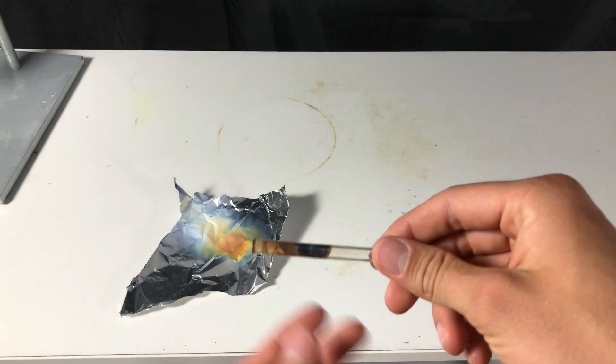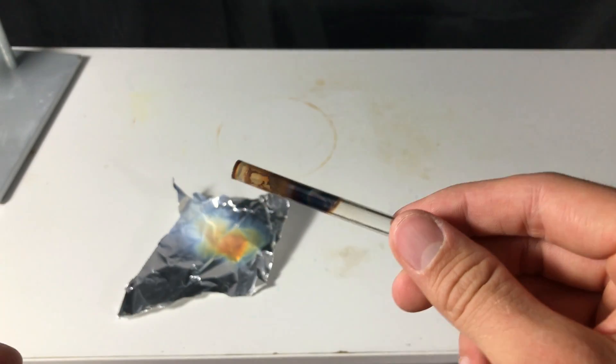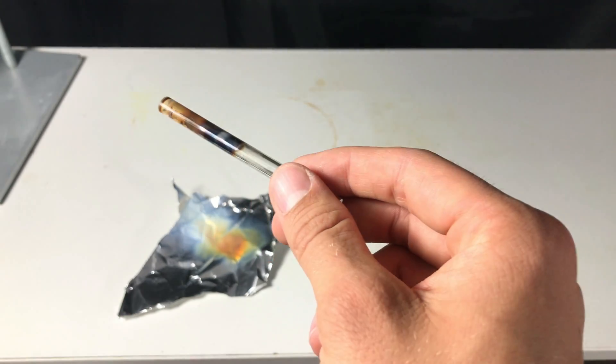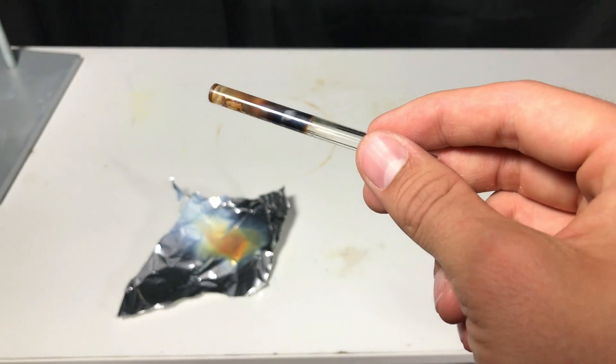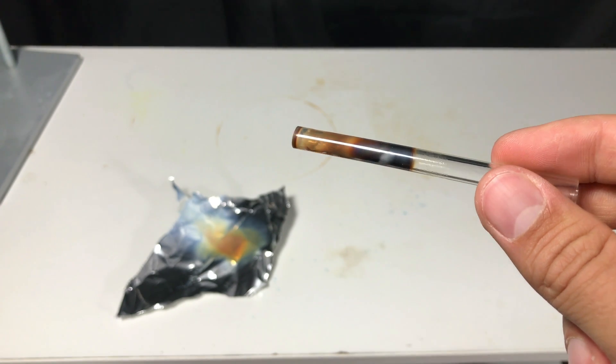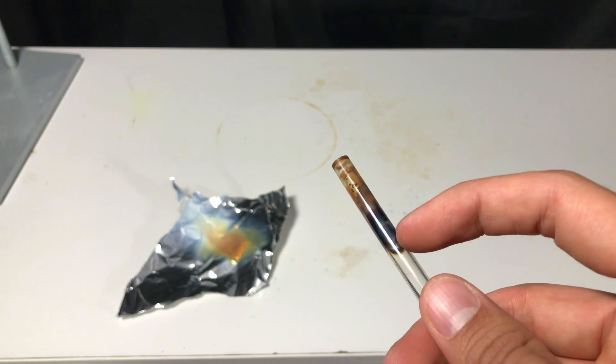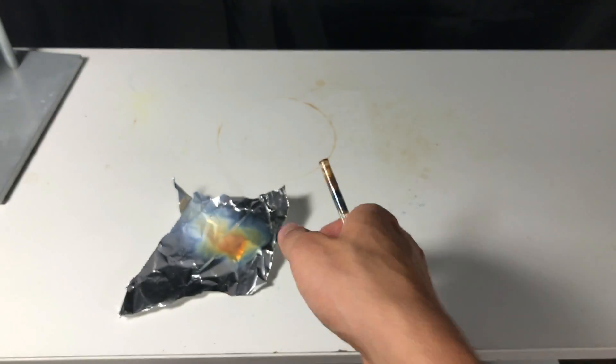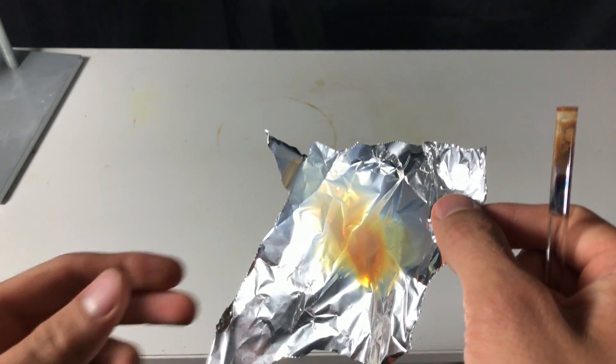I want to show you our silicon mirror a little closer. On the left of the glass tube, this isn't a silicon mirror. This is plain silicon dioxide. The black, silverish or in real life somewhat blue color in the middle of the glass pipe is pure silicon.